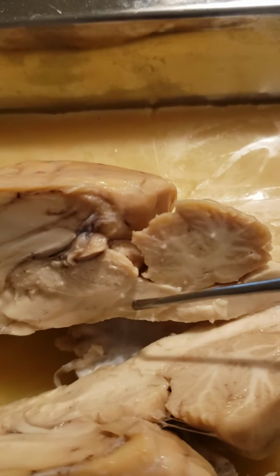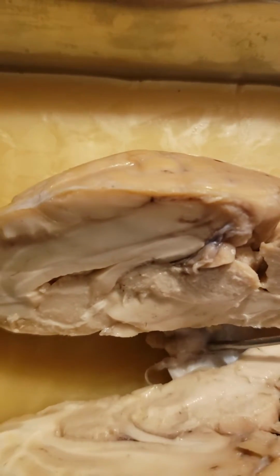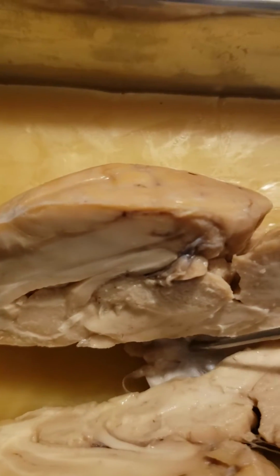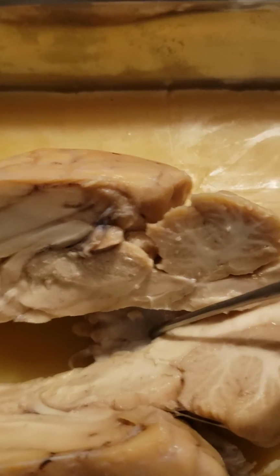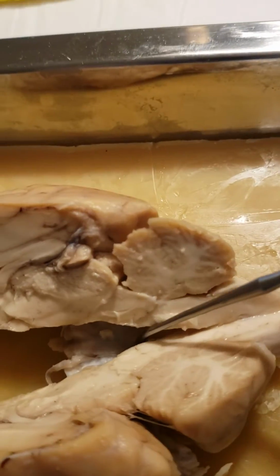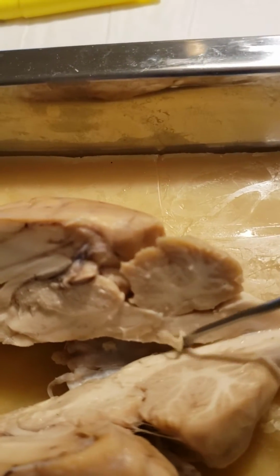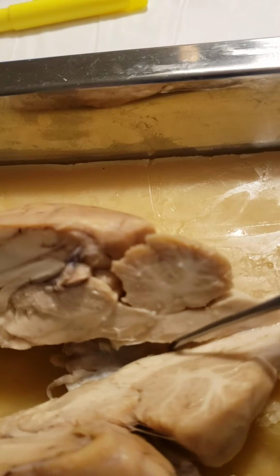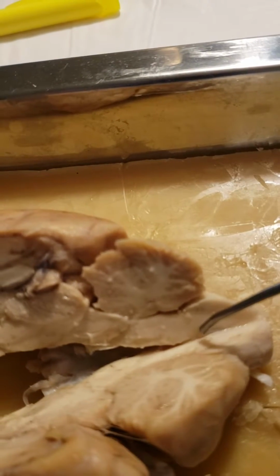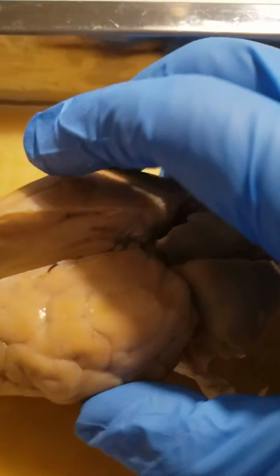And then the easiest way to tell midbrain, and I don't have a good view here, is as you go from here to here, there's a little bump here, and that tells you where pons starts, and that's pons. And then from here to here is the medulla oblongata. So here to here is midbrain. This is pons, and then here to here, to the end, is the medulla oblongata. And then I'm going to flip it over. It's the easiest way to do this part.